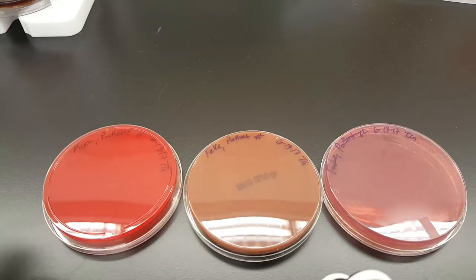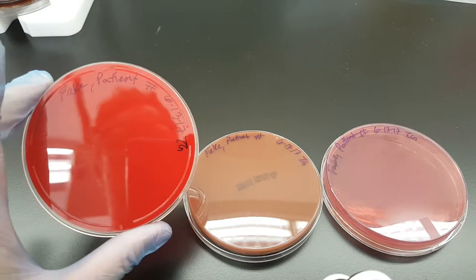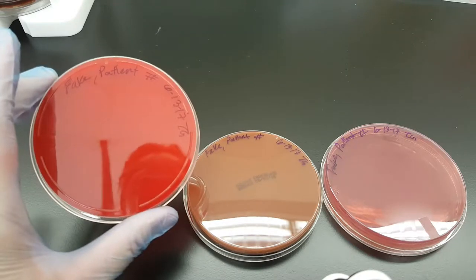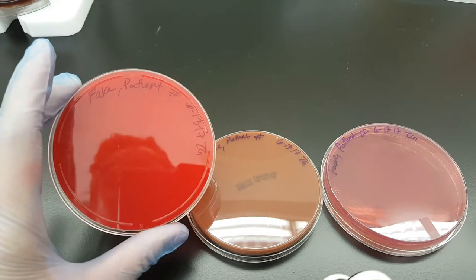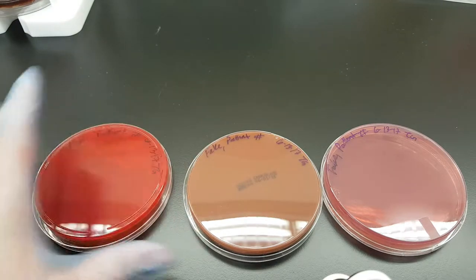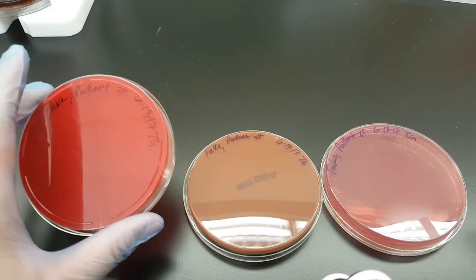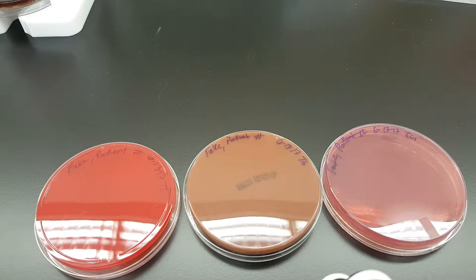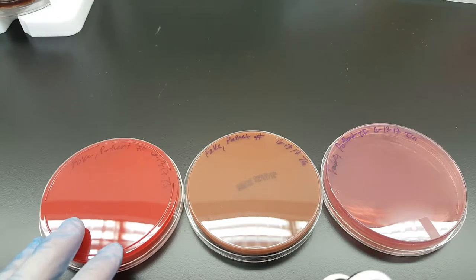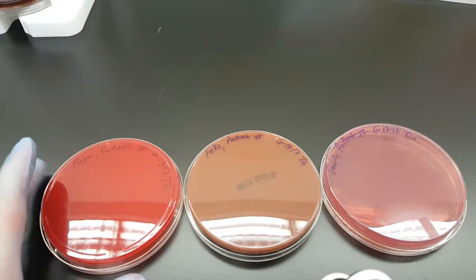The order that we are doing this is a really big deal. The blood agar is an enriched agar — it has all these nutrients in it so that basically everything is going to grow on it in an aerobic or capnophilic setting, meaning increased CO2 or a normal incubator. So we're thinking facultative anaerobes or aerobes are going to be the organisms that grow on these plates, because of the way they're incubated and the way they're made.